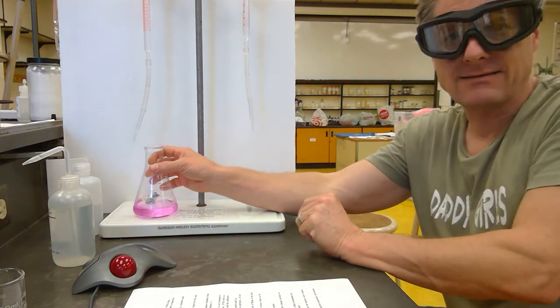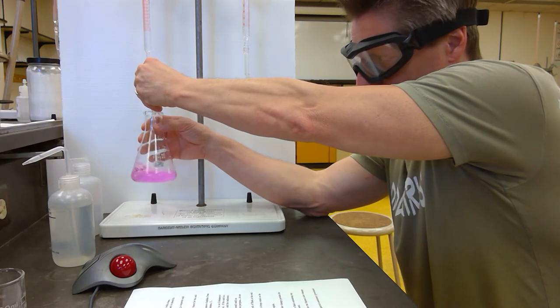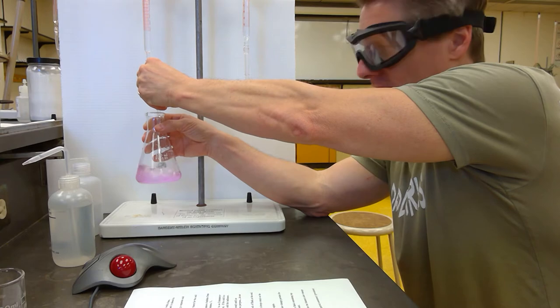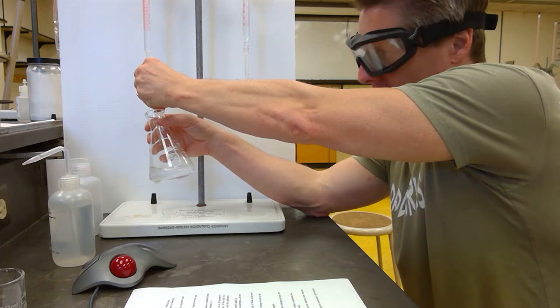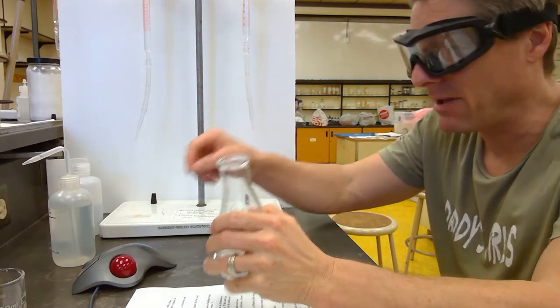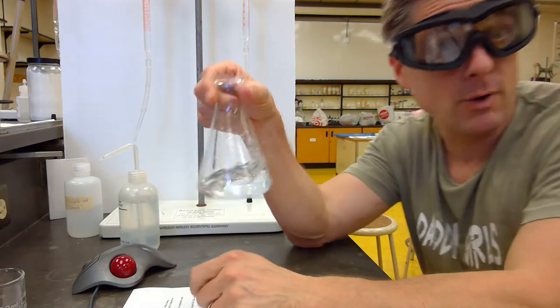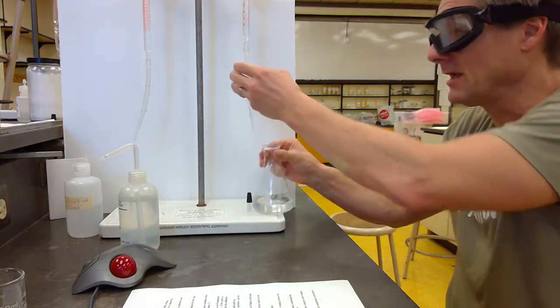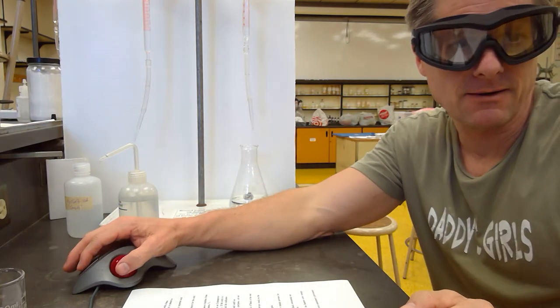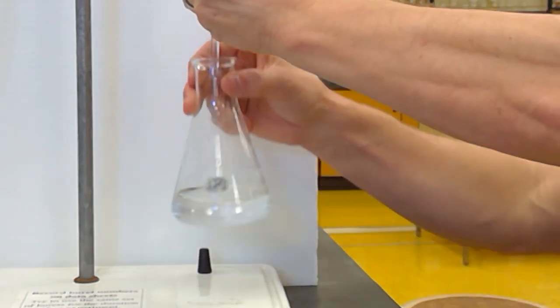So let's head over to the back titrant here. And you'll see, I'll just add that. I've recorded all the initial volumes. So I'm just adding this. Now watch the color fade. Boop, gone. I'm going to tap that drop off. Every time you take it away from the Mohr burettes, tap off the drop and then spray that down. We're pretty close, right? I'd say we're very, very close. So I'm going to come over to the base. Now I'm just going to add one drop at a time. I'll zoom in again here. So I'm just going to add one drop.